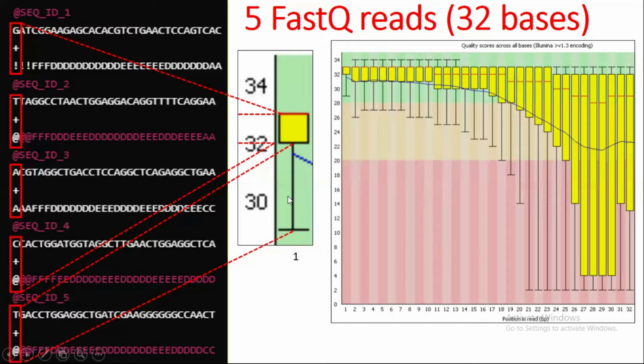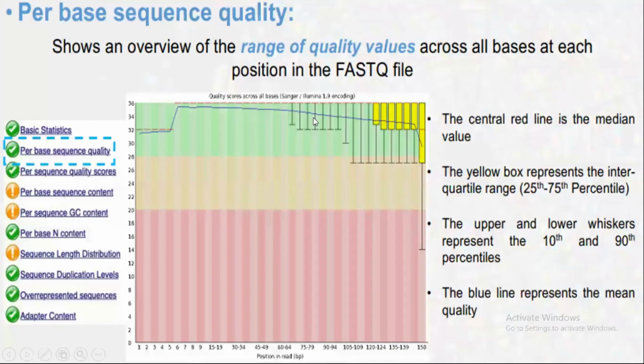After that, this whisker is a little bit larger, so we can say that a couple of reads have a quality between 32 and 29. If there is no whisker, we can say that almost all the reads, the 25% of the reads, revolve around this median. That is the reason there is no whisker here. And the blue line represents the mean quality.